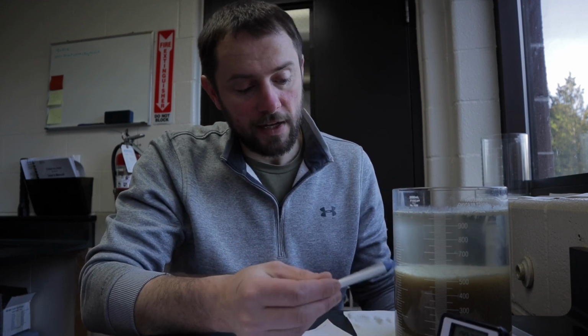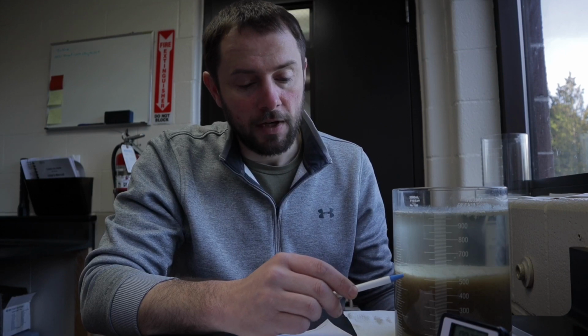So what we do is take the final value, the actual space that's occupied, and we divide it by the mixed liquor concentration that we got with our probe. 550 is around where we settled at 30 minutes, and our mixed liquor concentration was 3430. So 550 divided by 3430 is 0.160. We times 1,000, so that makes the SVI 160. In this case, it's not a terrible SVI, not for our plant and not for what we're doing right now.